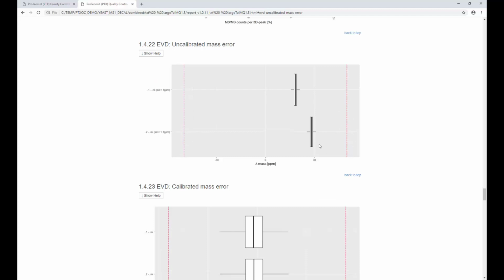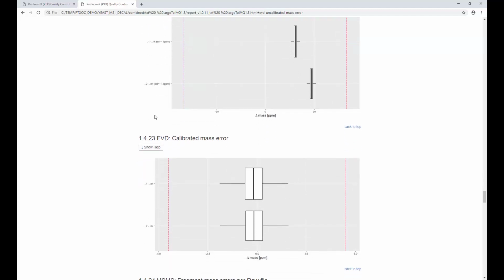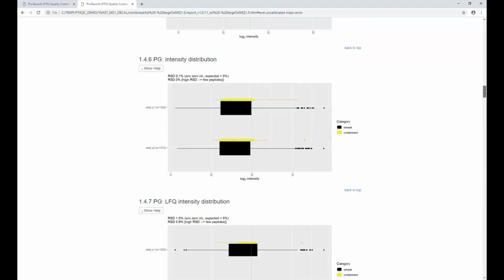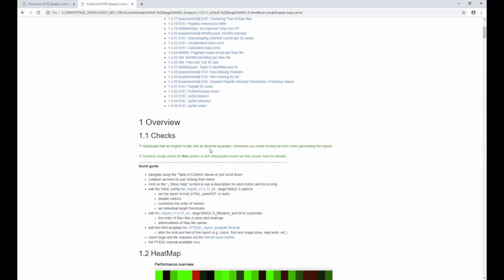And now all of a sudden, the second sample could be successfully recalibrated by MaxQuant. The standard deviations are also down, which is nice. And so we have a lot more peptides identified. And now those samples are actually comparable. Okay, so what else did we see in the first report, which might trip us a bit? So again, or still, let's say the top N is bad. So let's see why that is.